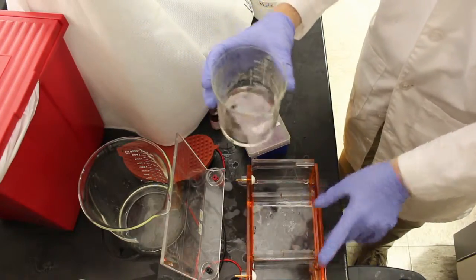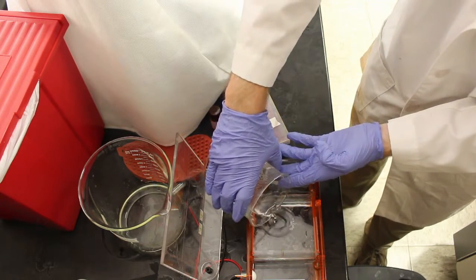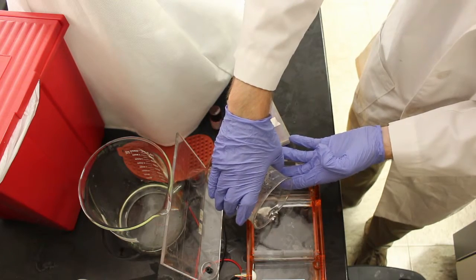Pour the solution into a mold. This particular mold fits within the electrophoresis chamber. Other molds may be independent of the chamber and require balancing adjustments.